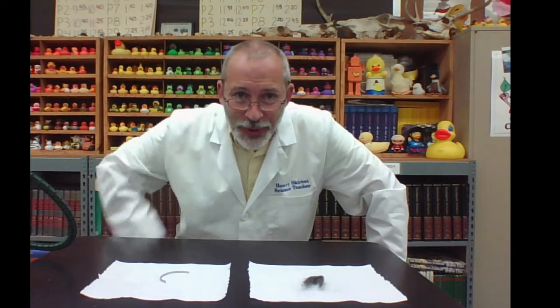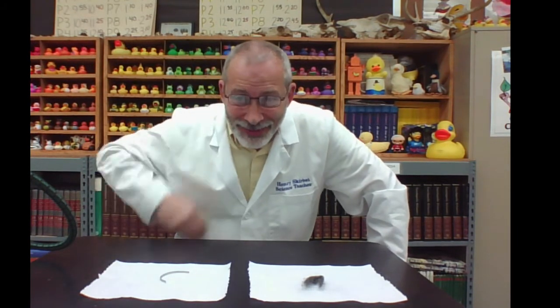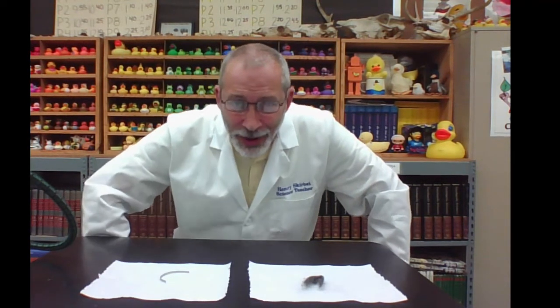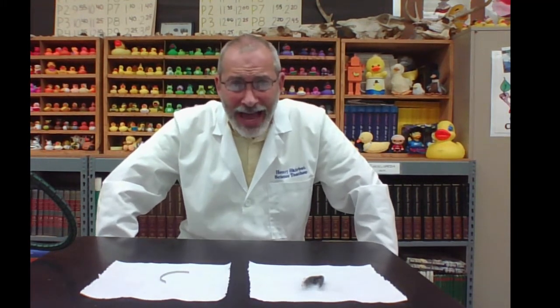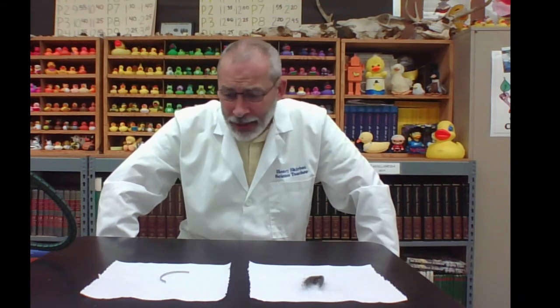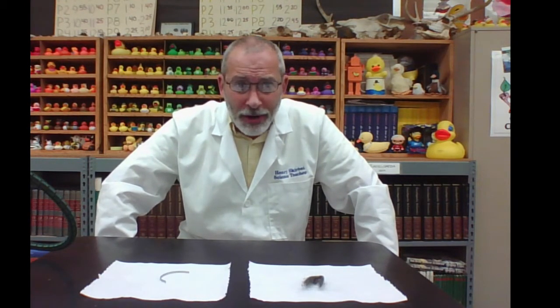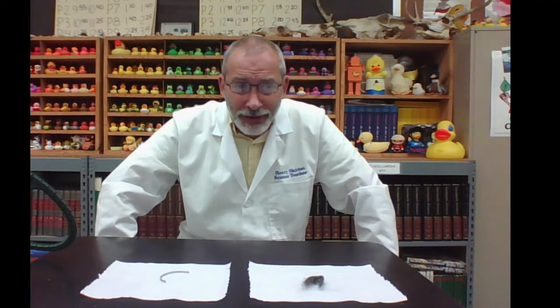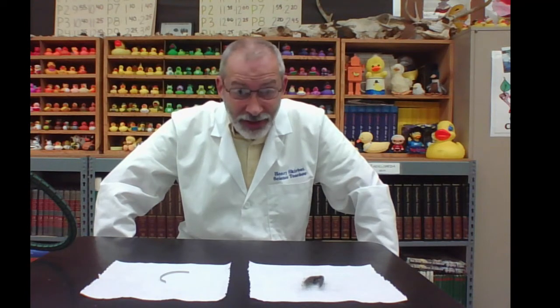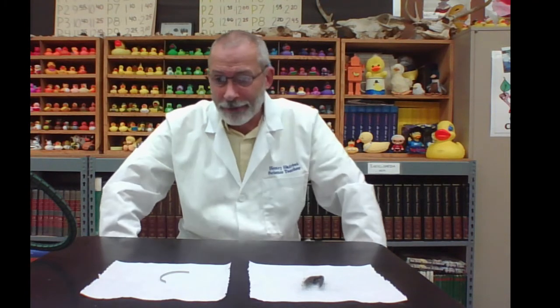Hello students. We are here in the actual lab today because I can't perform this experiment in front of or on the green screen material. So let's begin.